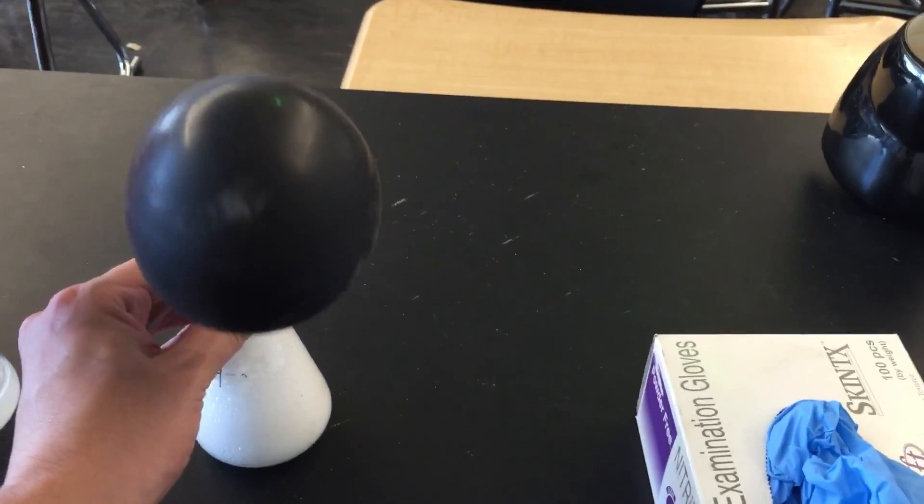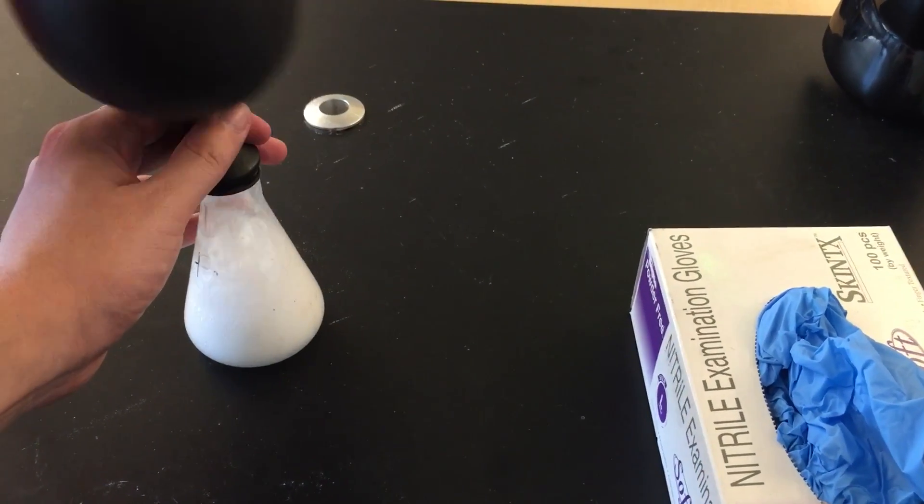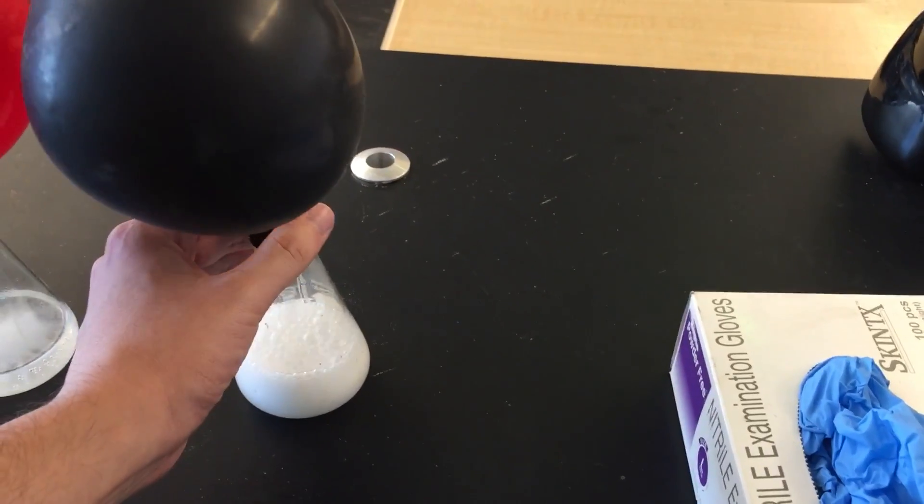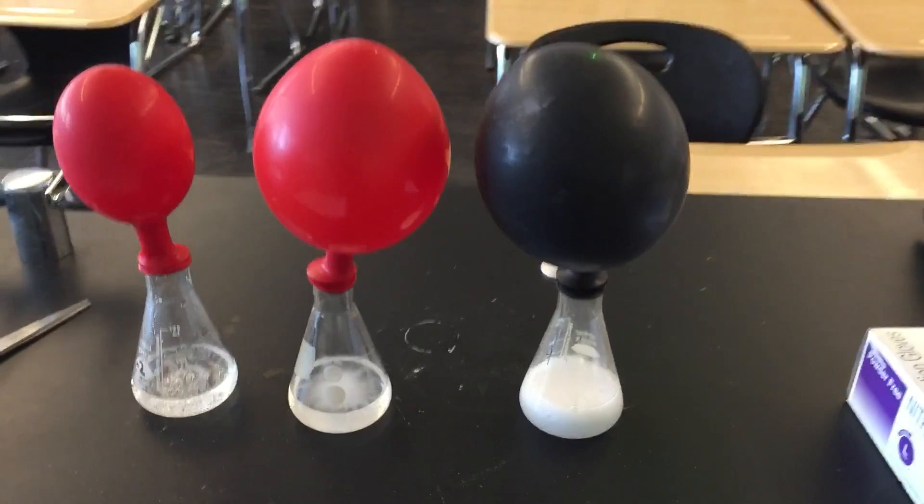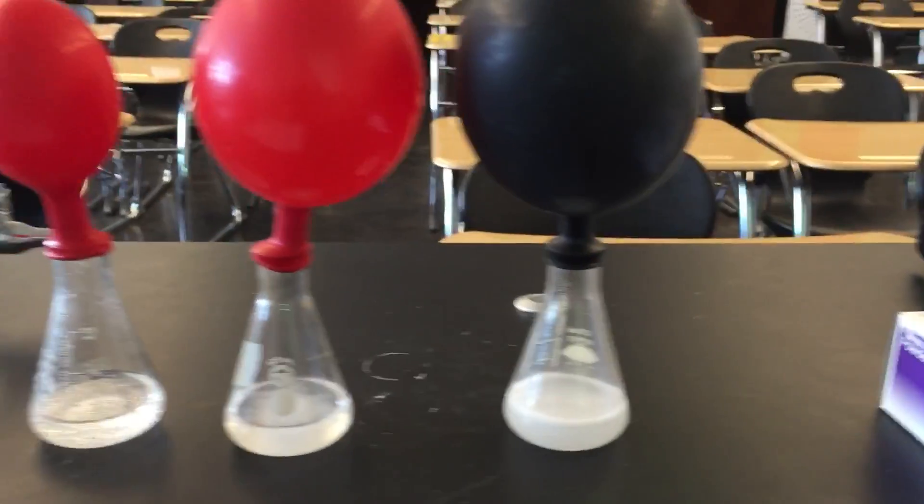That one's getting weighed down because there's liquid getting inside. So now try to get the liquid out. There we go. And so this is our result. And that one's still going on. So that's number three.